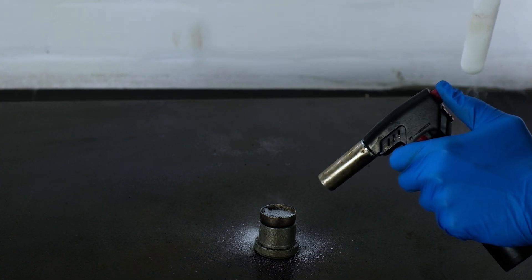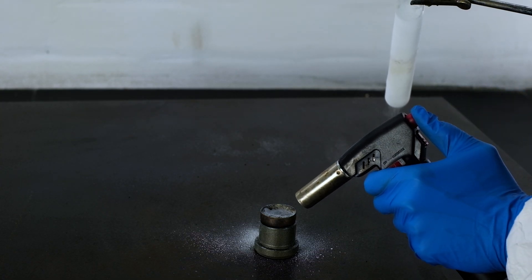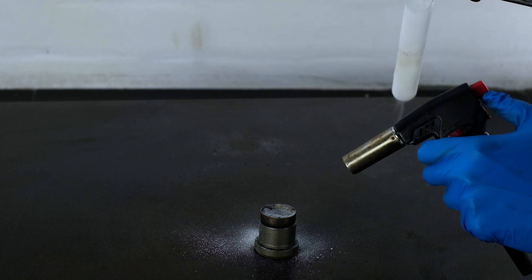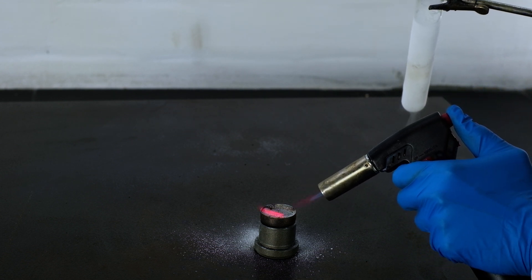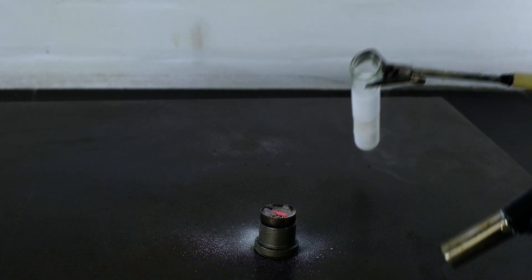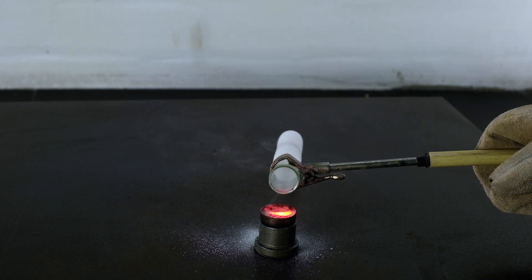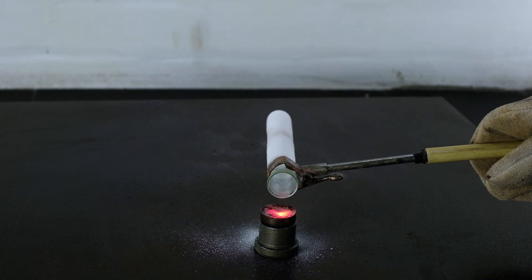I found out that lithium hydride powder self-ignites in nitrous oxide. I tried it several times to make sure it's true, but no self-ignition occurred. That's why in this reaction I will pour liquid dinitrogen monoxide onto lithium hydride that is already burning.